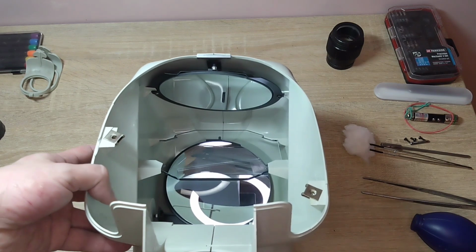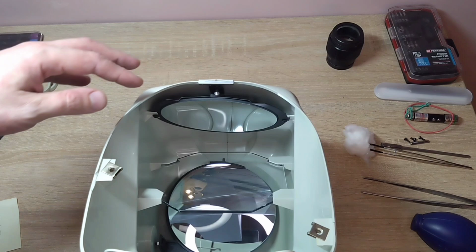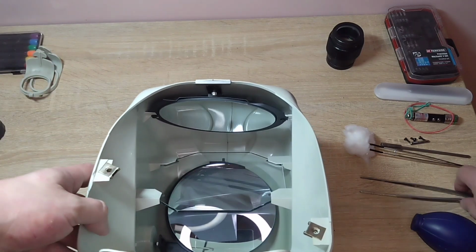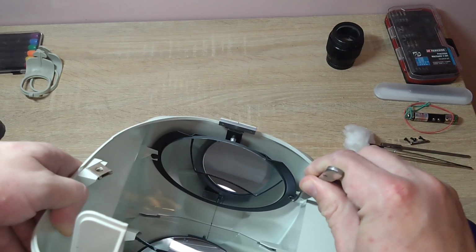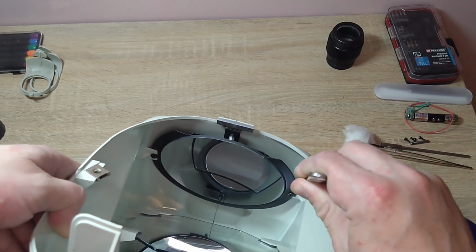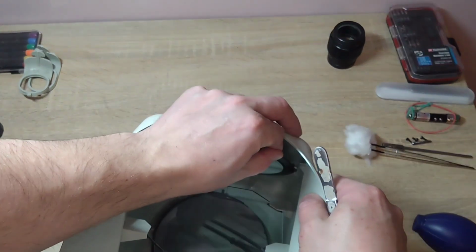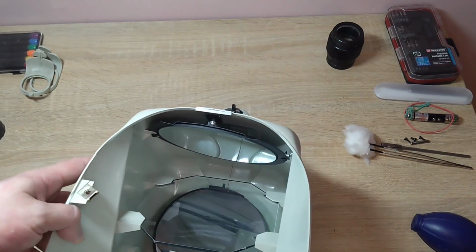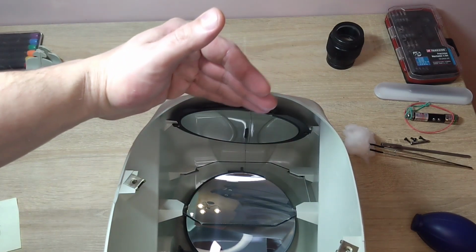In this 12-year-old video, I noticed that this mirror is secured in the same way as here. At first, I thought that someone might have done something here because I thought it was improperly secured in this place. In fact, it is secured the same way in that video as well. Indeed, here the mounting, this plastic is cracked. If you slightly pull the casing apart like this, the mirror shifts. I will need to try to secure it somehow, fix it, or glue it. This mirror is slightly misaligned.